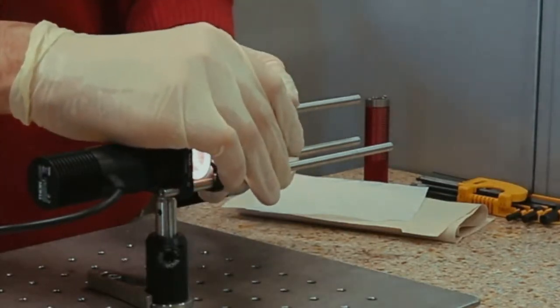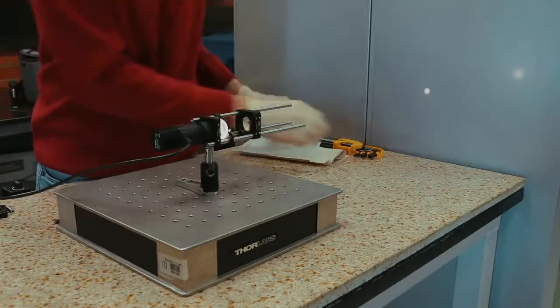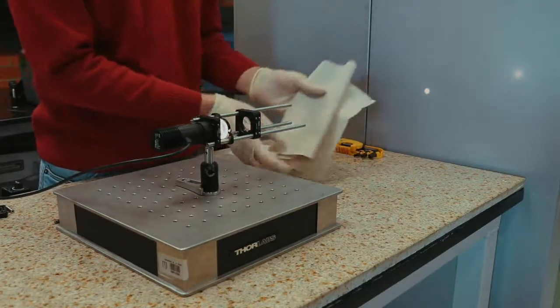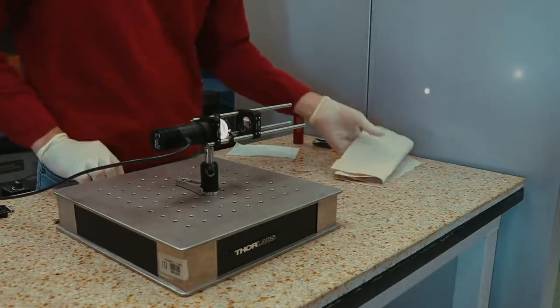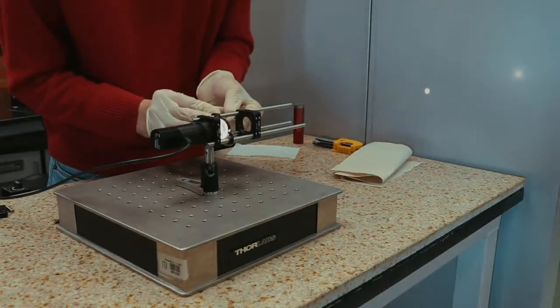While keeping the field diaphragm closed, adjust the distance from the Achromat to the iris until a collimated beam is achieved. Fix the position of the lens using the cage screws on the cage plate.